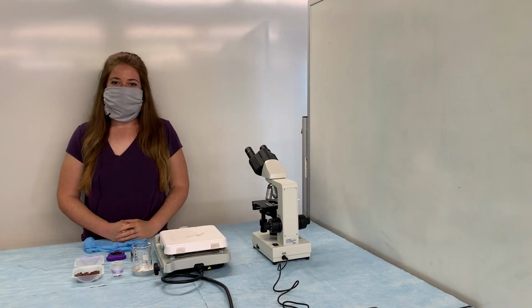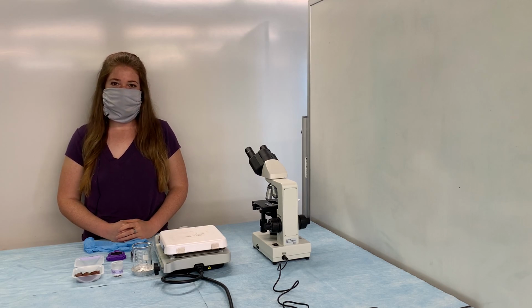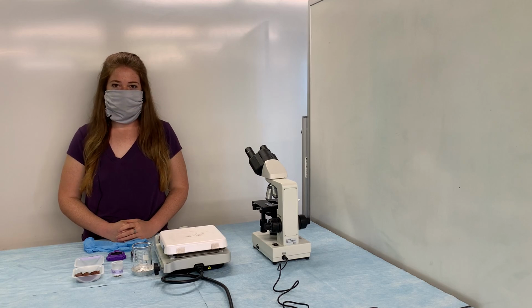Like I mentioned at the last station, we will now be producing and observing microspheres similar to those produced by Sidney Fox in 1968. I'm going to quickly summarize the procedure, then go through the steps that I discussed, and then we'll look at the microspheres under the microscope.